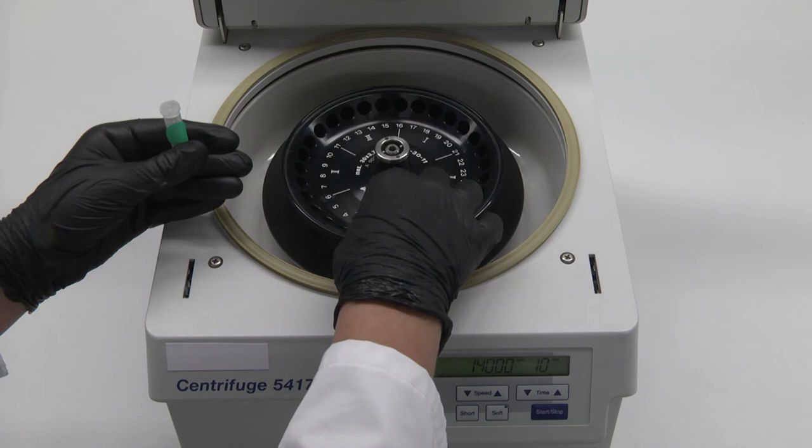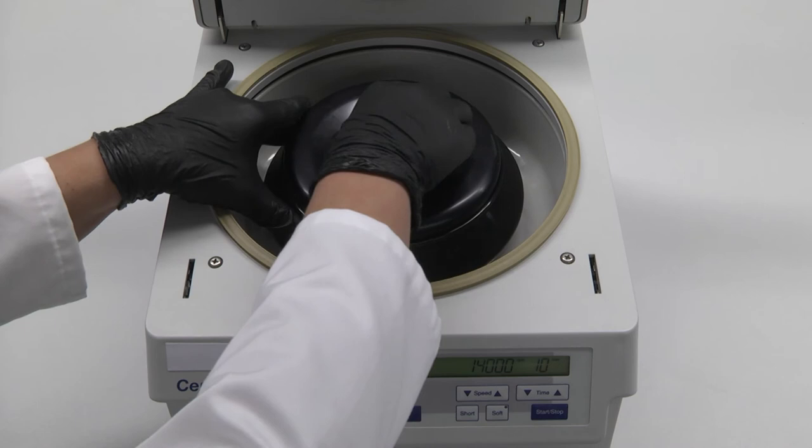Immediately transfer to small centrifuge vials and centrifuge the sample for 10 minutes. Alternatively, an ultra centrifuge for bigger vials can be used.